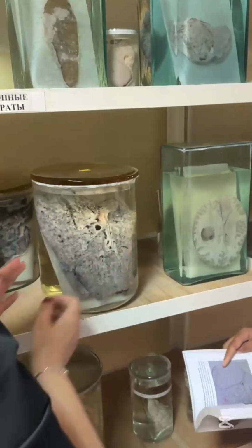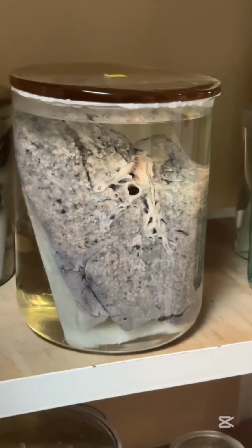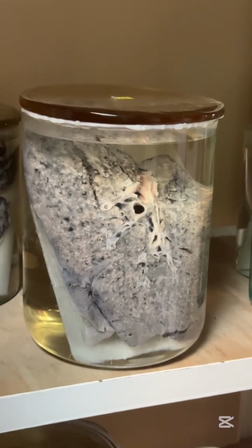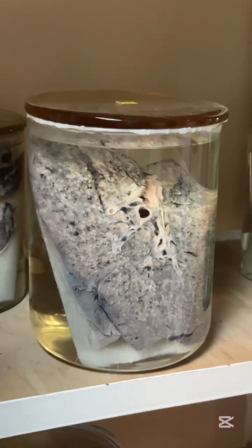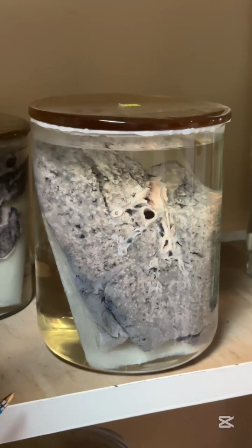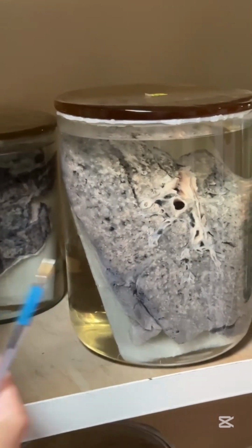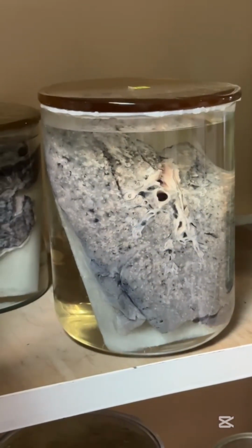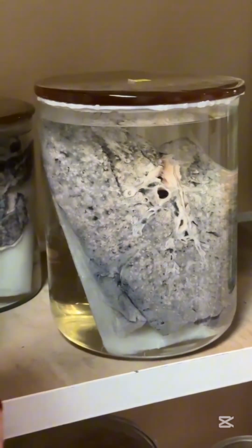Now, tuberculosis. You see lungs and multiple tiny focuses around 1-2 millimeters. That is miliary tuberculosis, like millet seeds. It may be type of hematogenous tuberculosis, or it can be after hematogenous progression of primary tuberculosis. But it needs invasion of mycobacterium to the bloodstream because it is hematogenous spreading. So hematogenous or progression of primary tuberculosis, miliary tuberculosis.